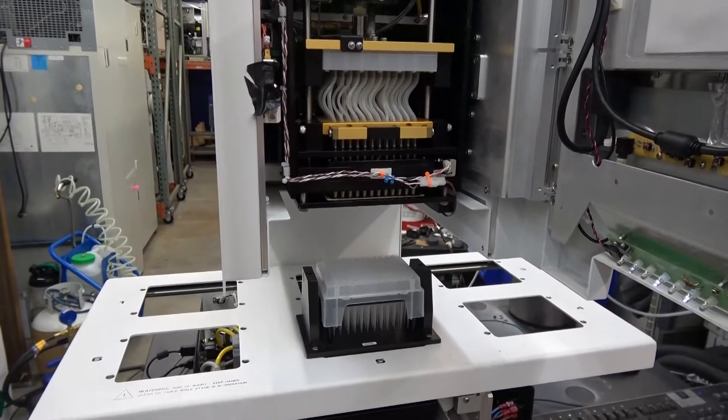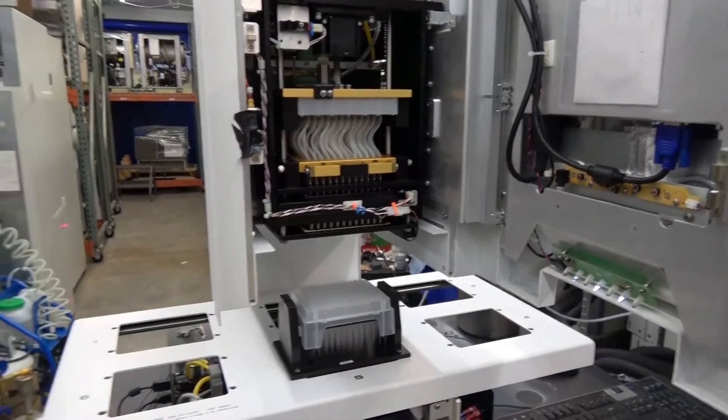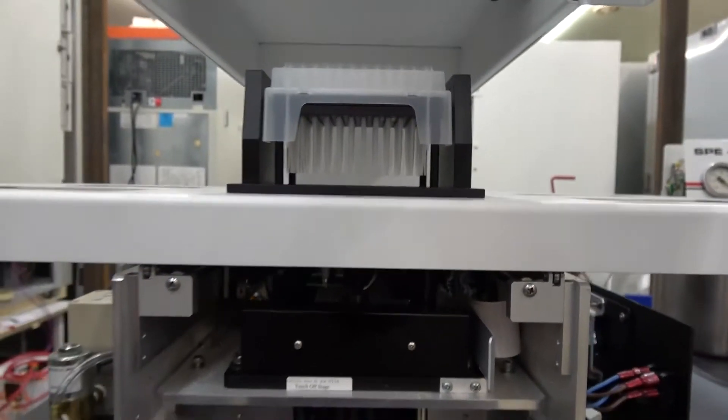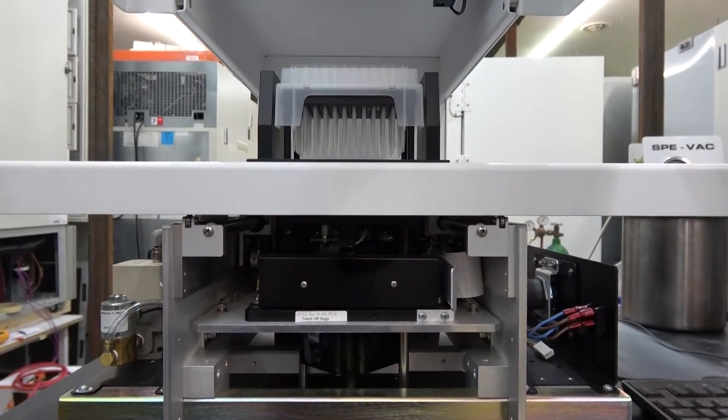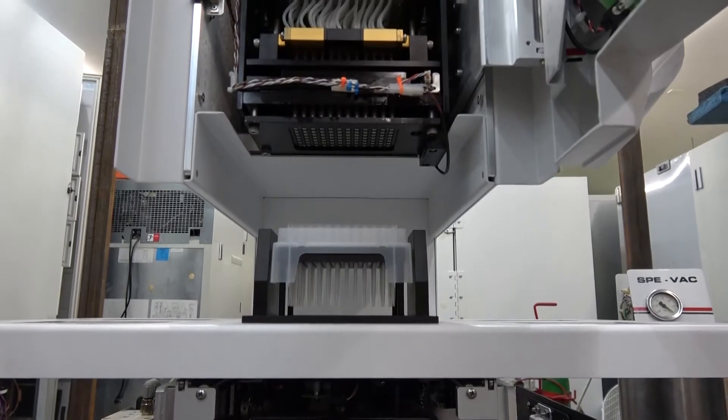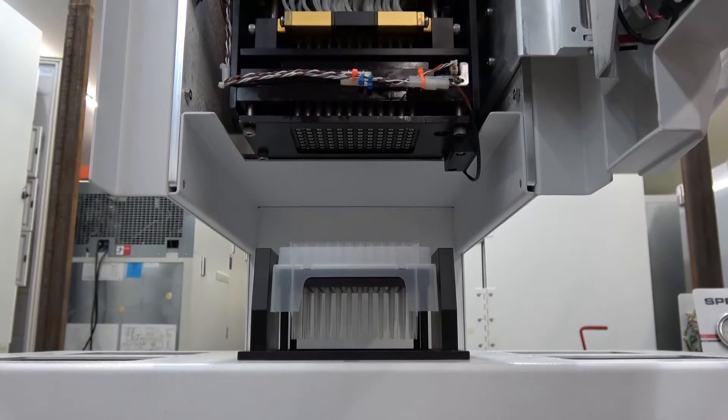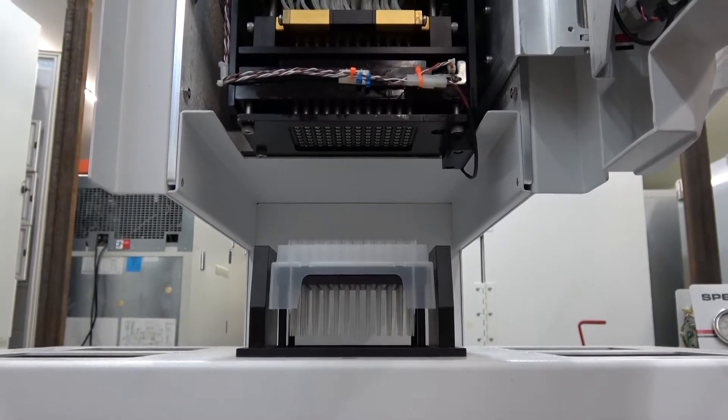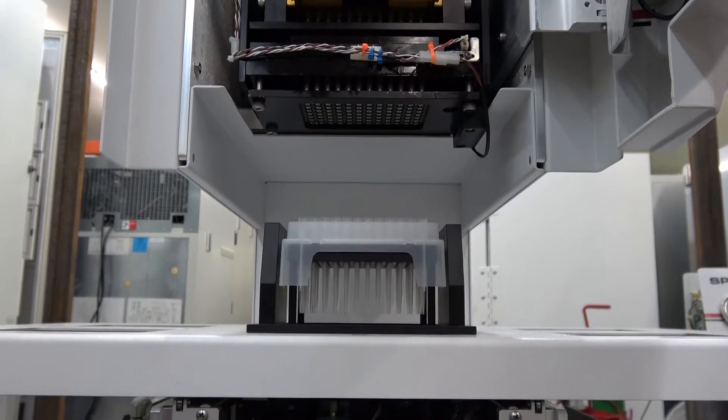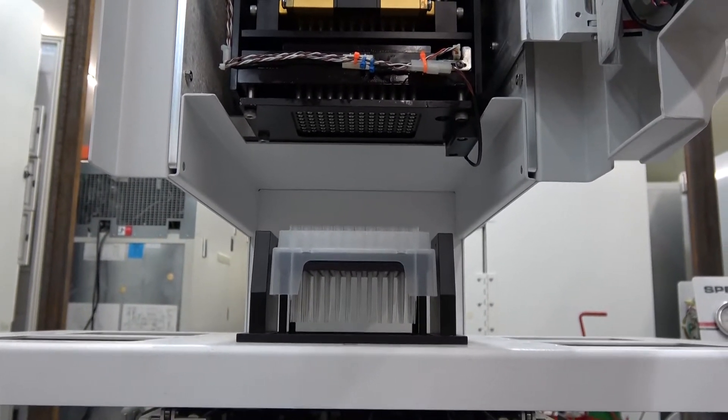I'm going to show you now how it moves the plate up and down to the pipetting head here. I'm going to go ahead and load some tips once I move the shuttle into position.